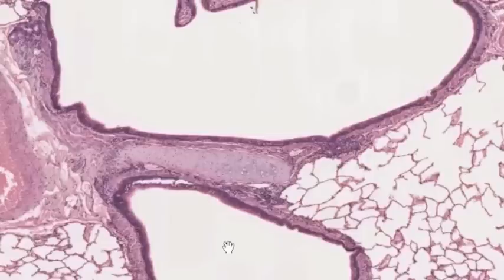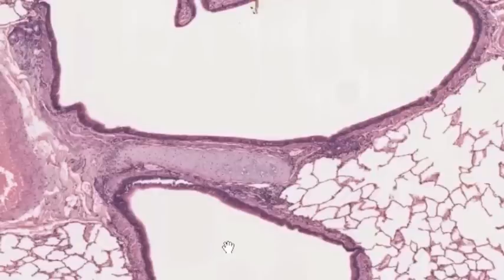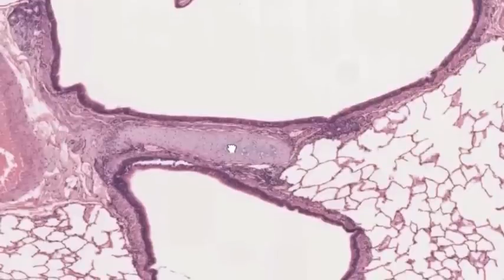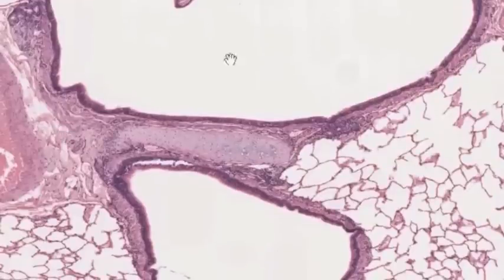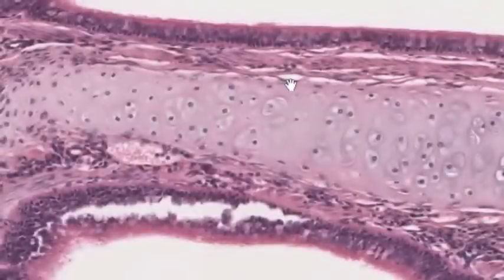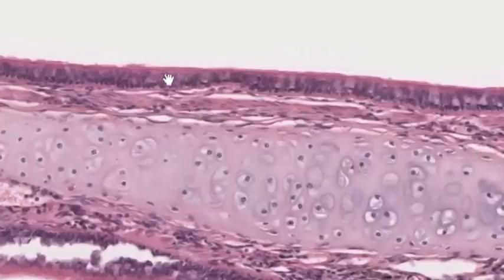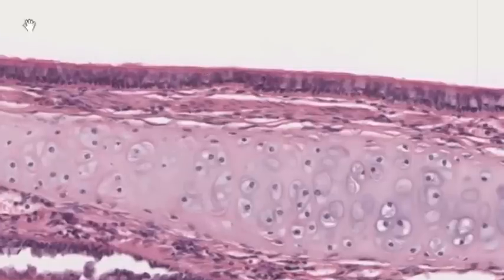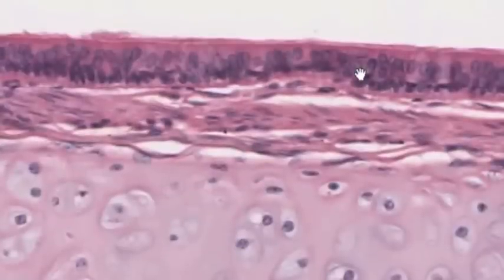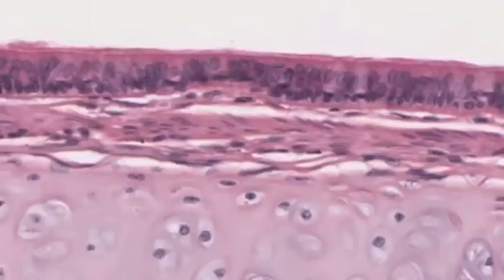These are probably segmental bronchi. Aside from the cartilage, which is the giveaway, we can increase magnification and look at the epithelium. Even without being at top magnification we can make out that this is a pseudo-stratified columnar ciliated epithelium with some goblet cells — respiratory epithelium, characteristic of the conducting portion of the airway.